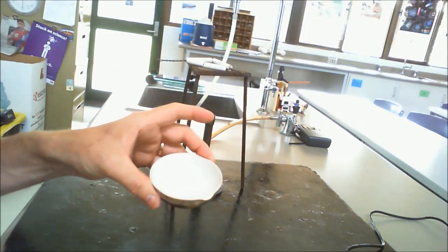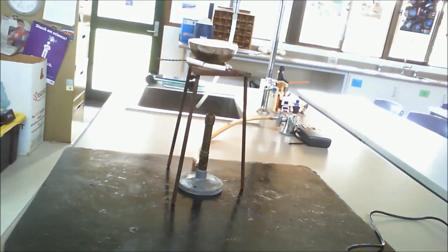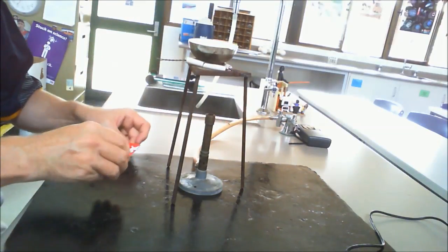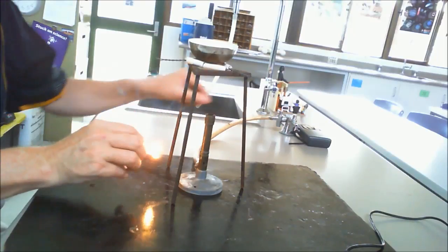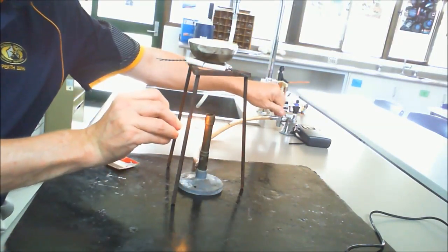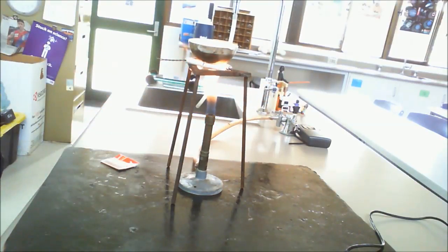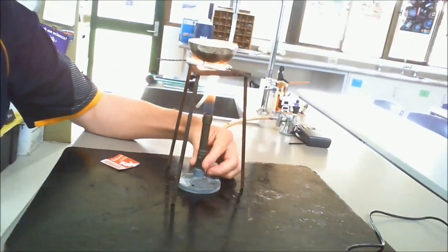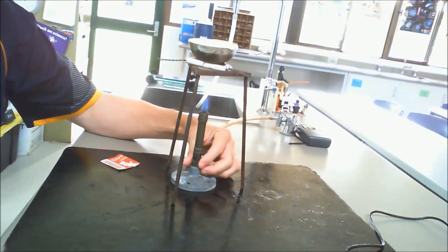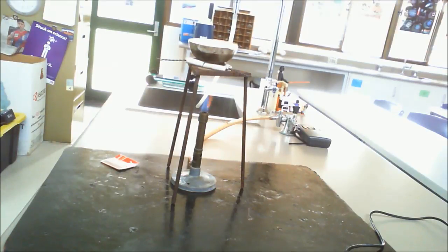So now we've got a white powder there. Then what we do is we evaporate this off. So again, making sure that the Bunsen holes are out, and there's our safety flame, but with everything we put it onto a blue flame. So what we do is we basically now will evaporate that off, and that's just a standard evaporation.